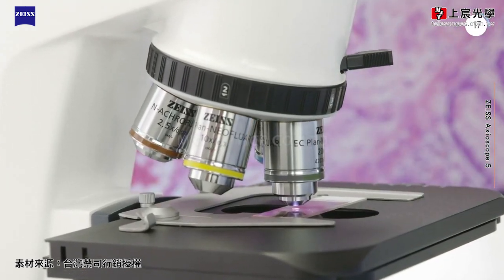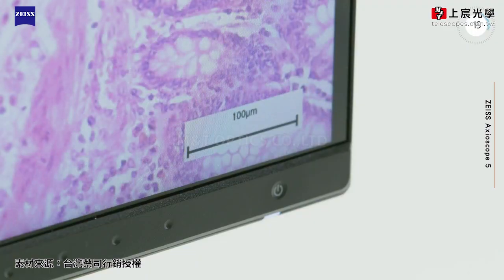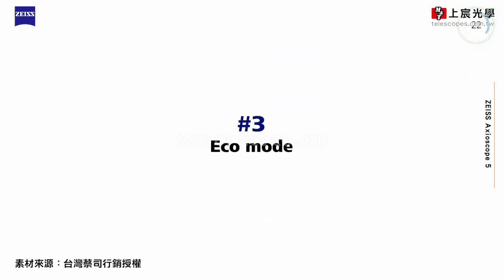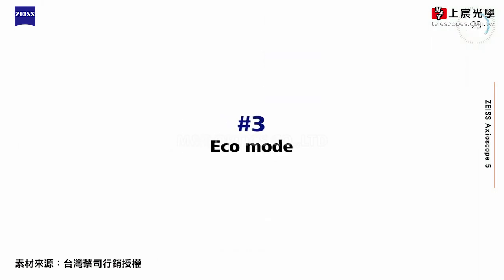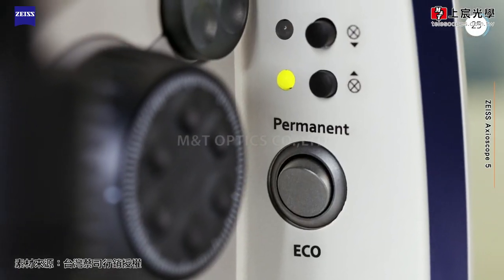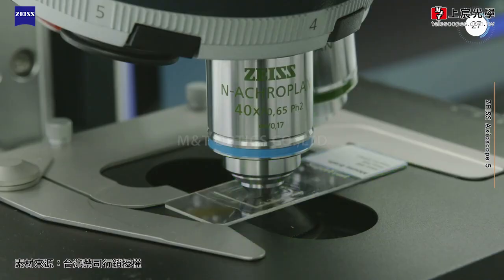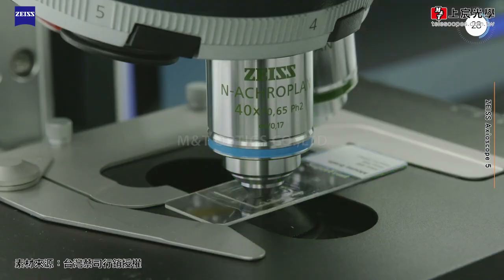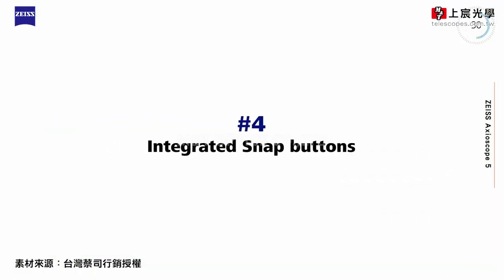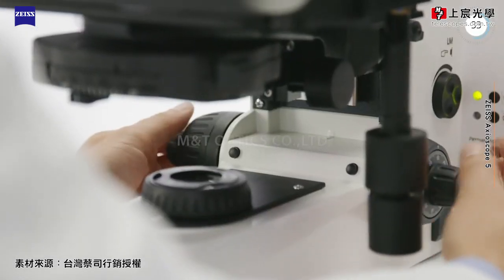Your image data is saved with the correct scaling and metadata. Axioscope 5 goes to standby after being idle for 15 minutes, which saves energy and extends the lifetime of the illumination.